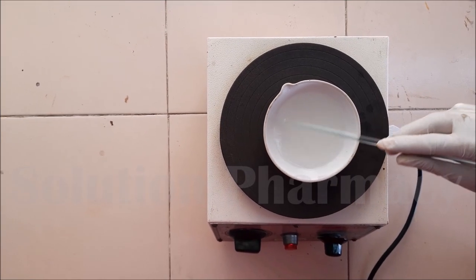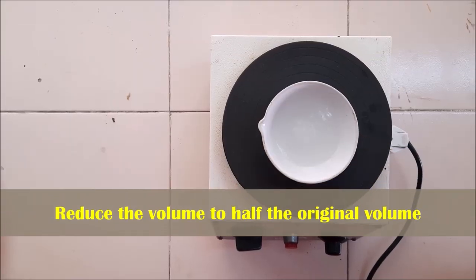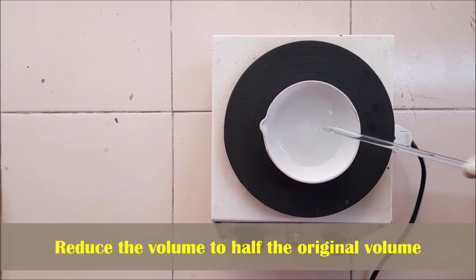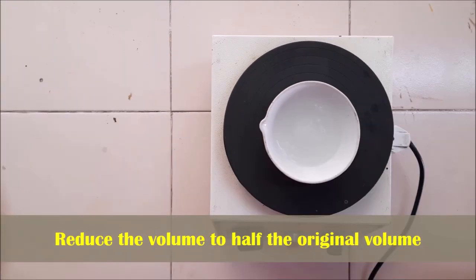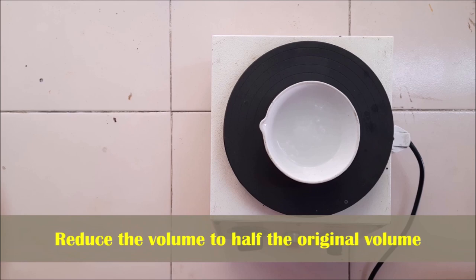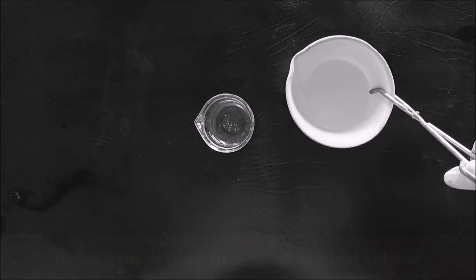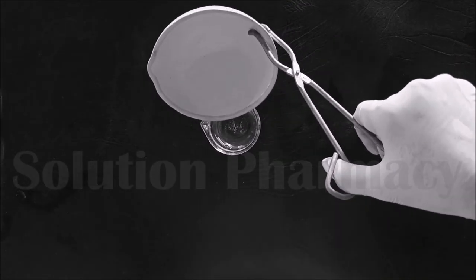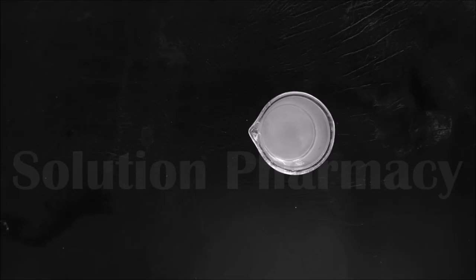Continue heating the solution until the crystallization point is reached. Here you can see the solution volume has been reduced to half the original volume. Now remove the hot concentrated solution from the hot plate and transfer it into a clean and dry beaker.